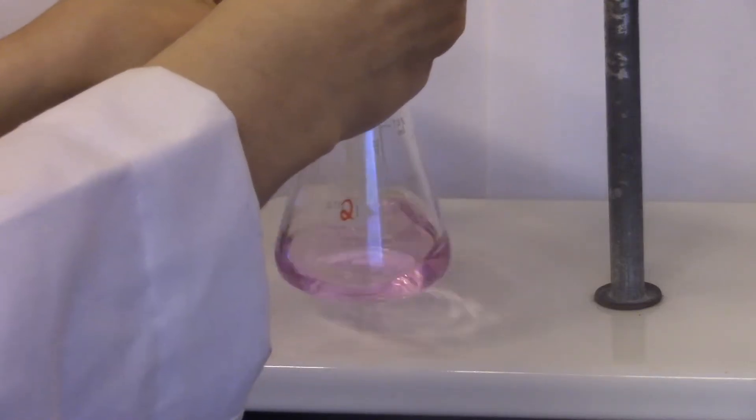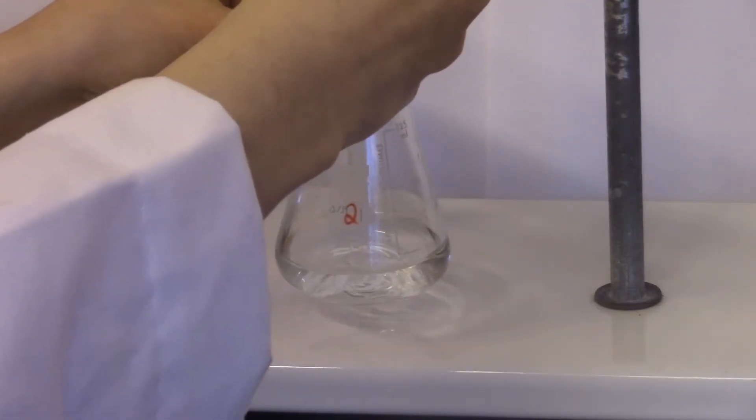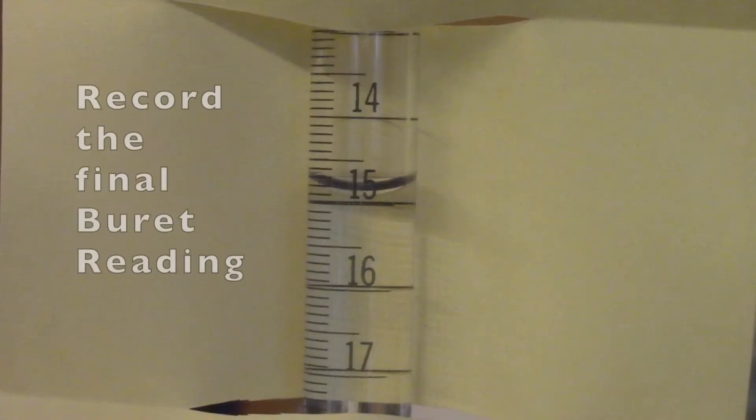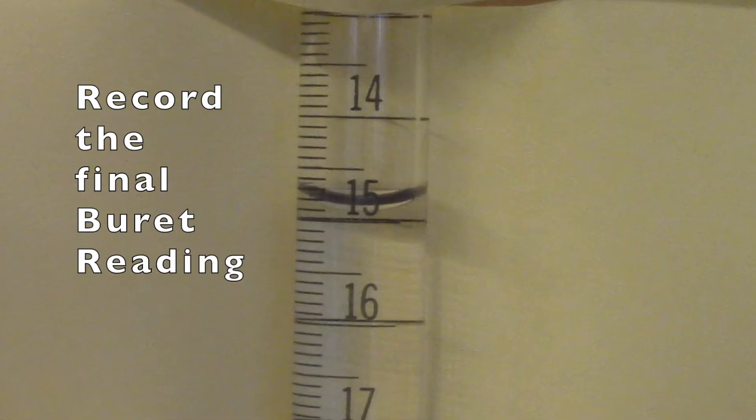Let's look at it again. Record the final buret volume.